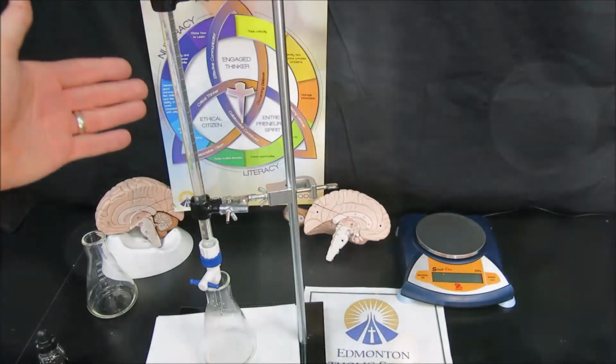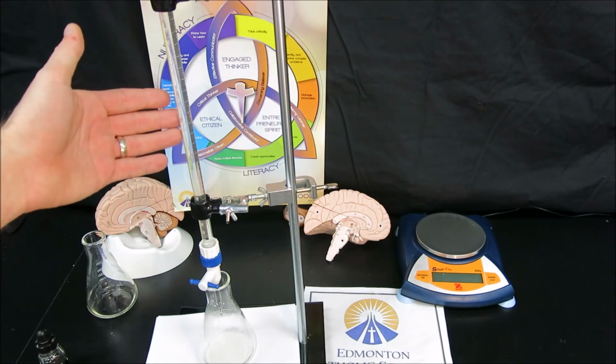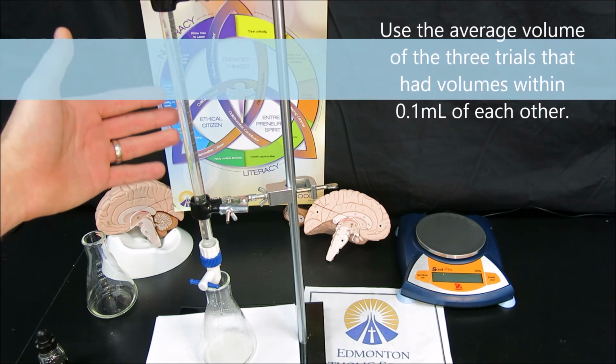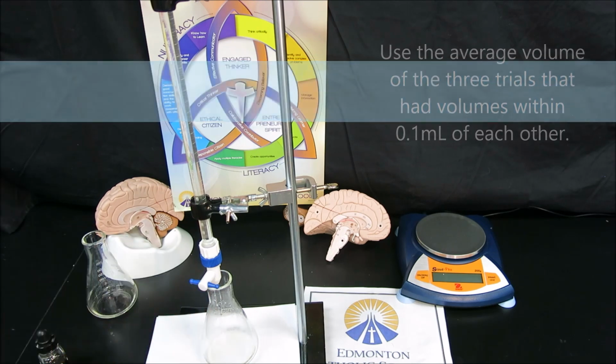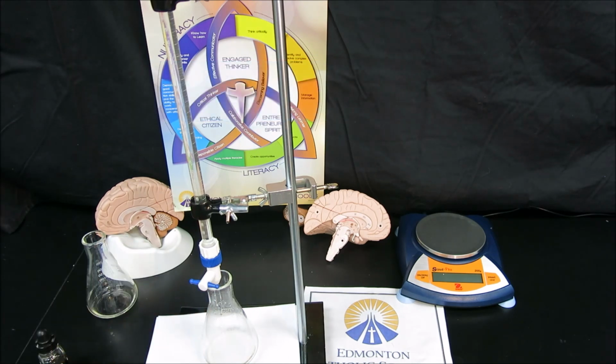With our volume of titrant, we can calculate the moles of titrant that were used to reach equivalence point. From the moles of titrant, we calculate the moles of sample. Once we have the moles of sample, you go ahead and calculate the concentration of the sample based on the titration data.